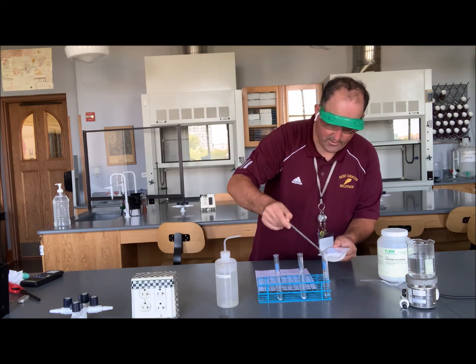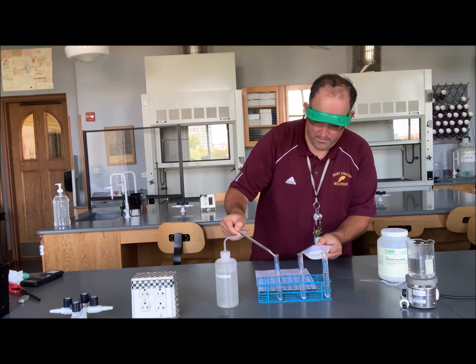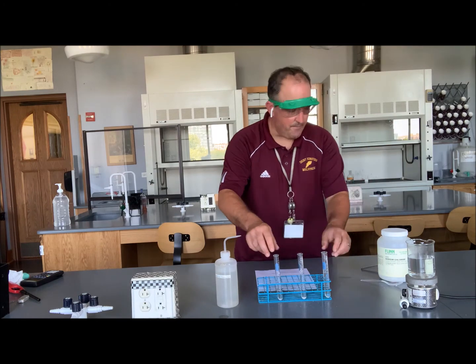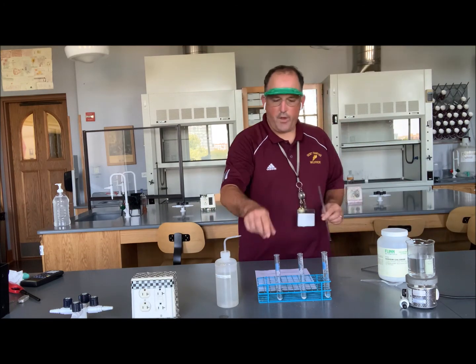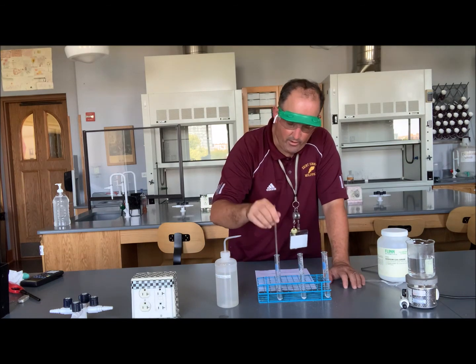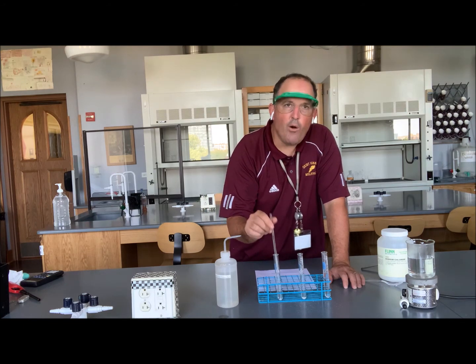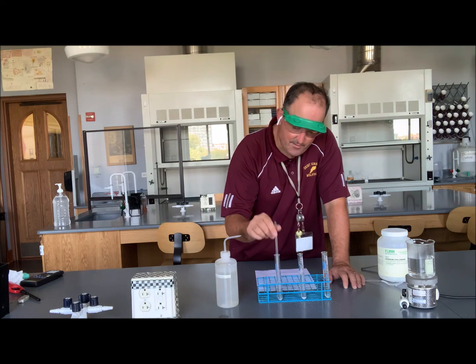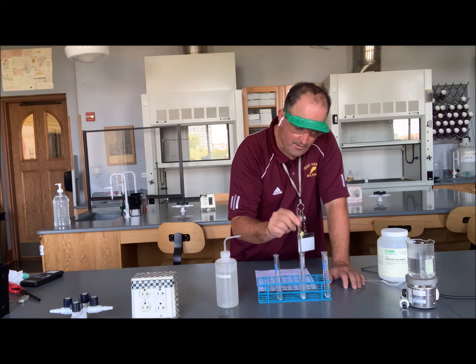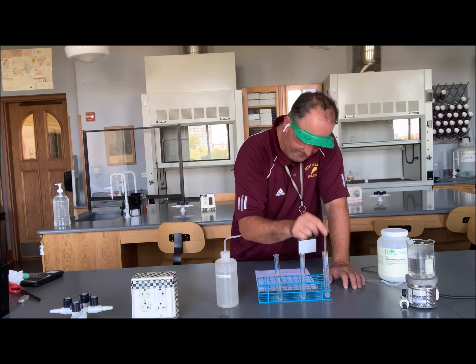And then, as the directions say, I'm going to swirl the test tubes, gently swirling each one. One way to swirl, you can do this with your wrist, that would be fine. Or I've got a glass stirring rod, and you just agitate the water up and down a little bit. We'll do this for about 1 minute and see if we can notice any differences. A little bit of swirling here, about equal amounts of swirling here. It is nice when you have multiple lab partners, you can all be swirling at the same time.